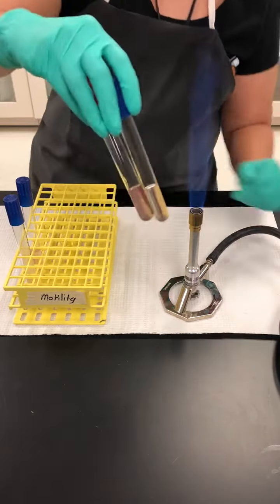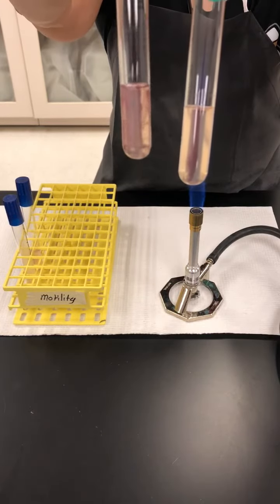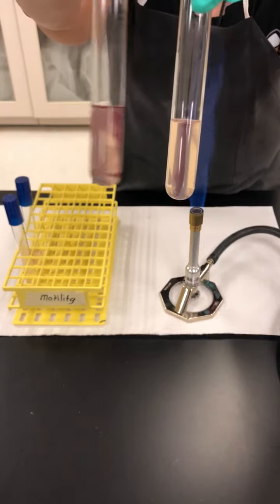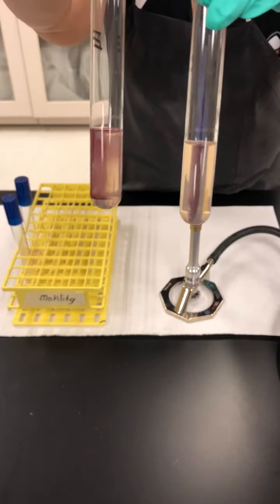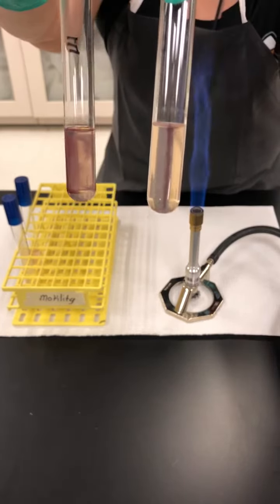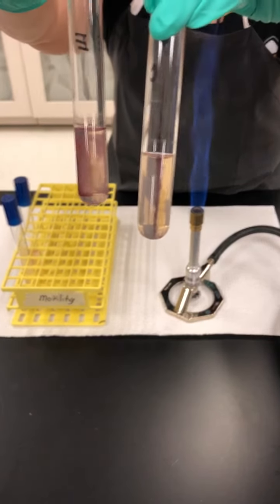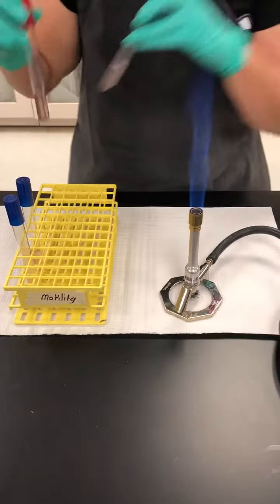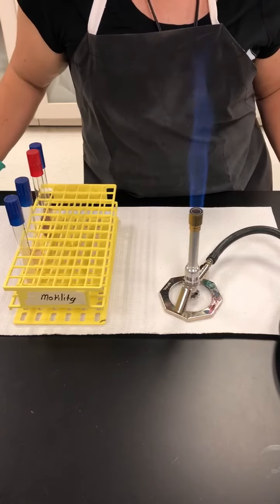Here we have two different bacteria. Notice that on this tube, the E. coli, there is radiating growth that looks like what I like to refer to as bright colored cotton candy. And on this tube, the Klebsiella pneumoniae is just a straight line where it was inoculated. This is an especially useful test when we're trying to differentiate among some of the gram-negative bacilli.